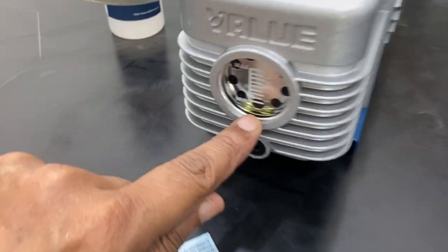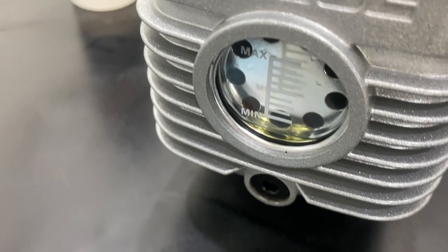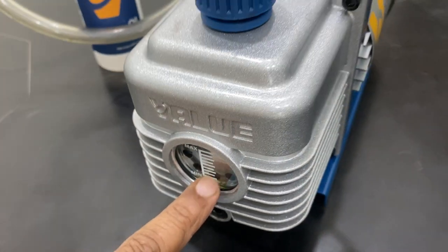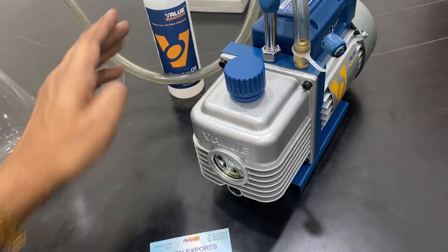Some oil is still inside — you can see there is oil here. So even this is sufficient, but you must use it. The minimum is this level and the maximum is this level. Better to use it to the half — you can use it again.